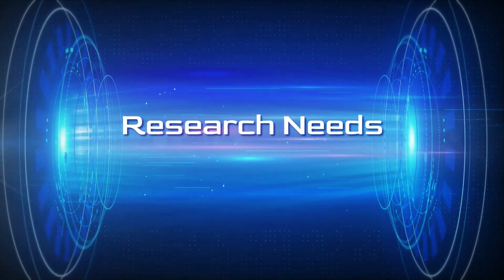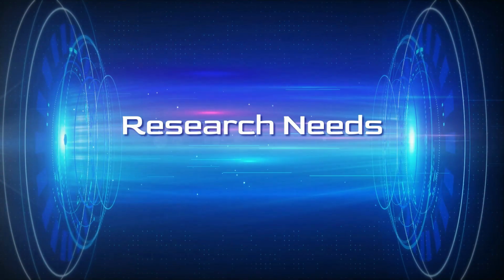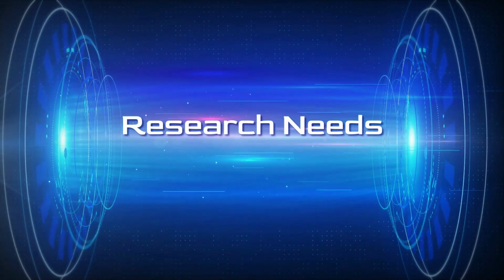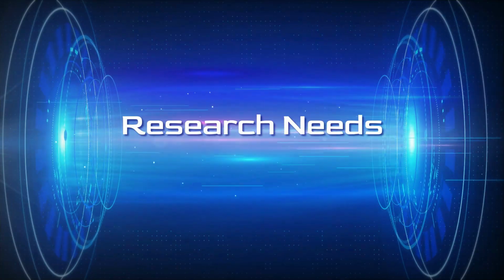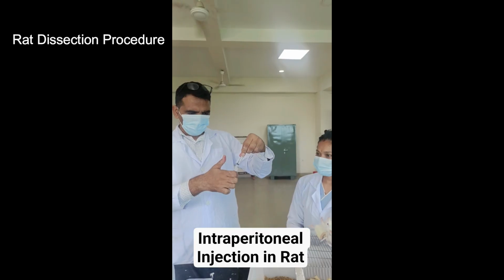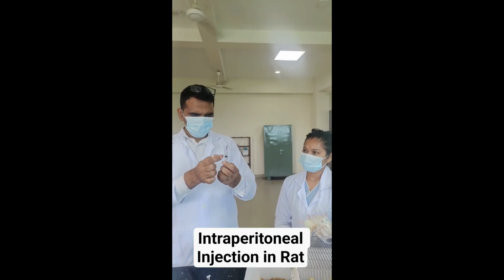In this video, we will demonstrate the proper technique for rat dissections, including positioning, organ identification, removal, and preservation for histopathology. All procedures must follow institutional ethical guidelines and safety standards.